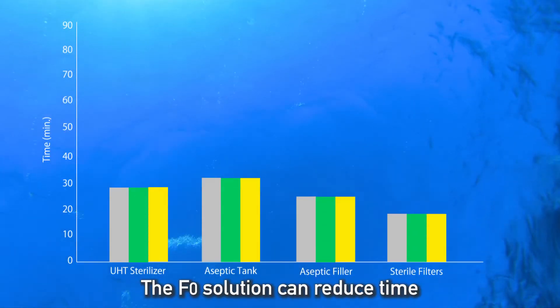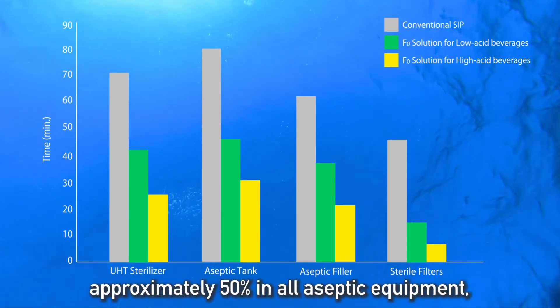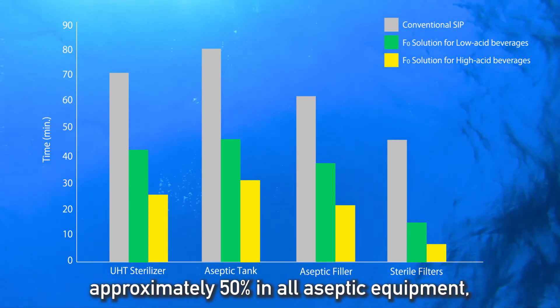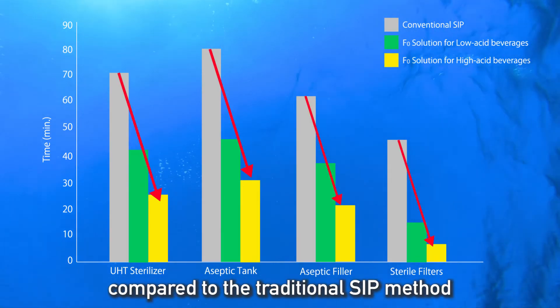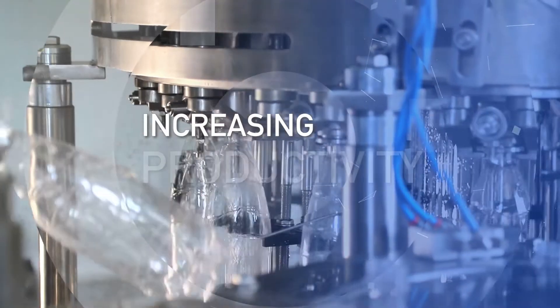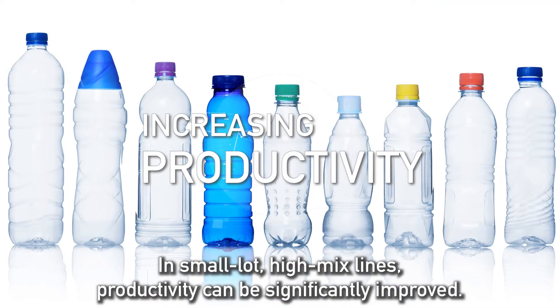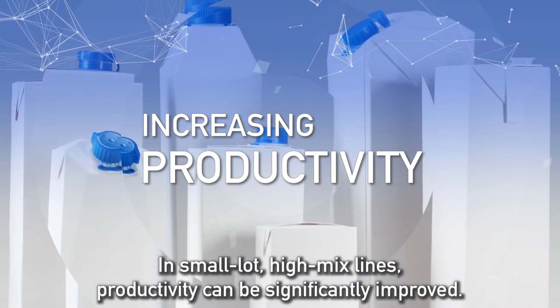The F-sub-O solution can reduce time approximately 50% in all aseptic equipment compared to the traditional SIP method based on temperature and timer. In small lot high mix lines, productivity can be significantly improved.